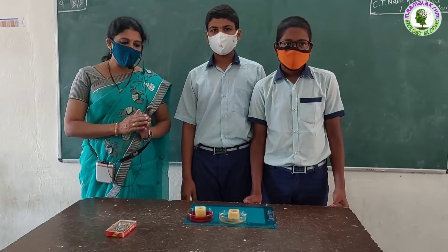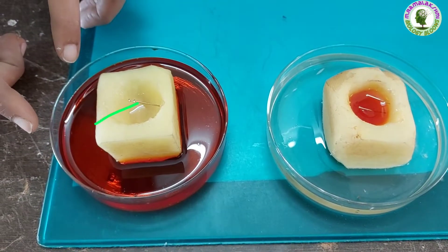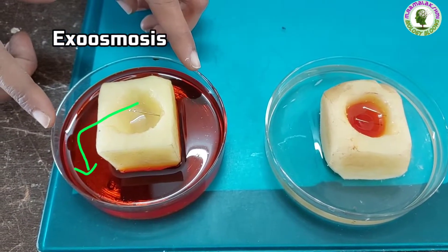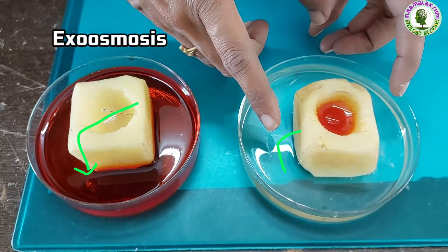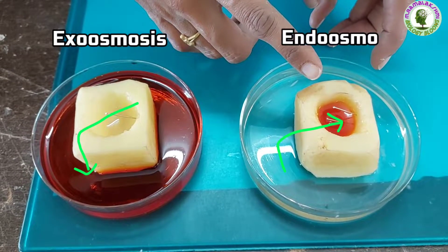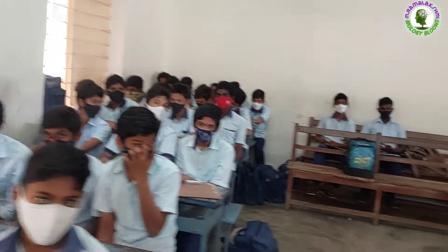Children, observe here — water from this potato cup has moved into the sugar solution in the petri dish. This is known as exo-osmosis. And in this case, water in the petri dish has moved into the sugar solution in the potato cup. This is known as endo-osmosis. So children, I think you understand about osmosis.